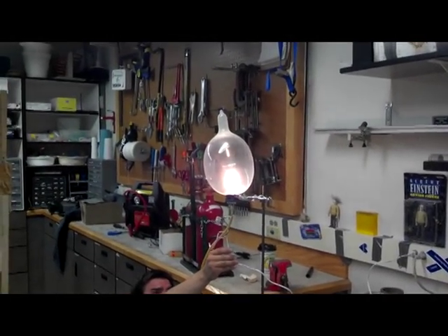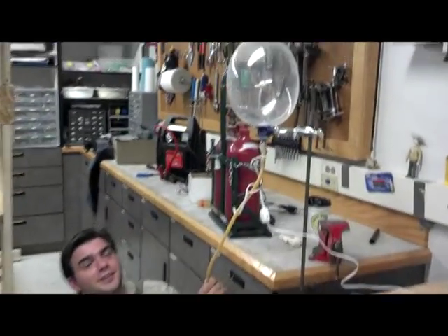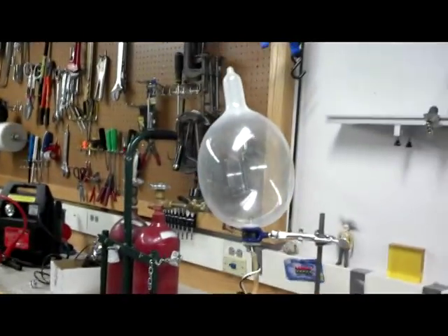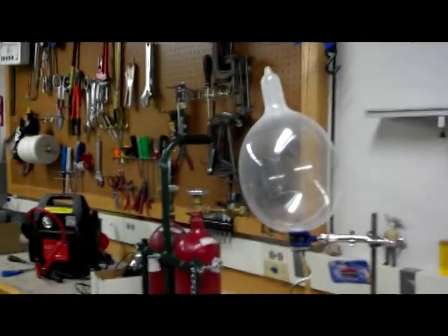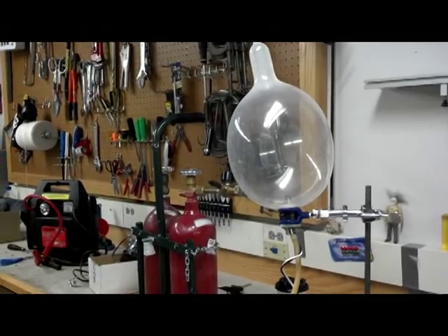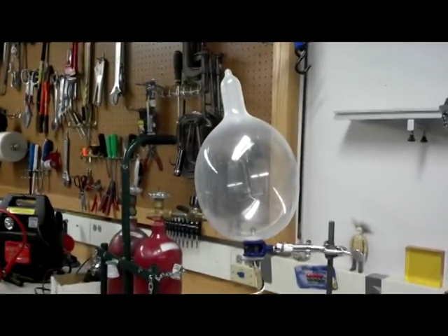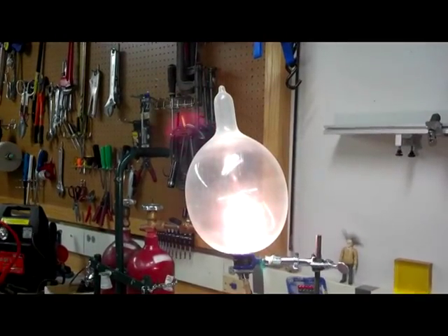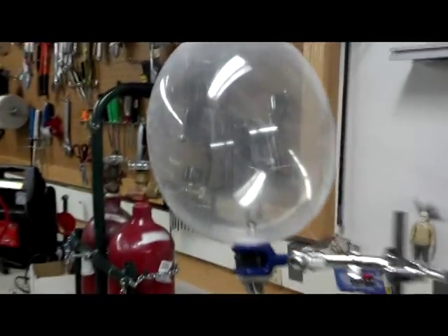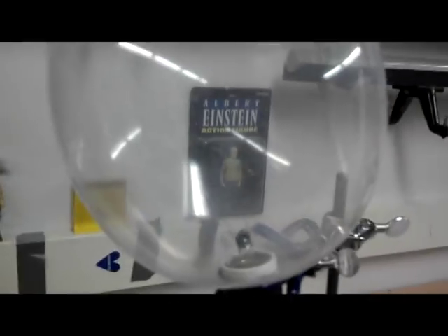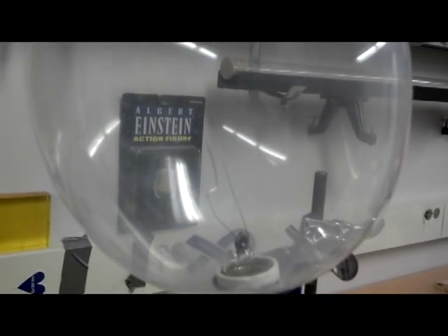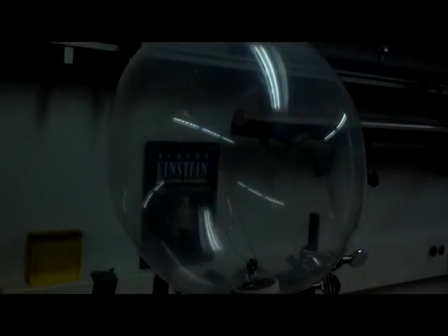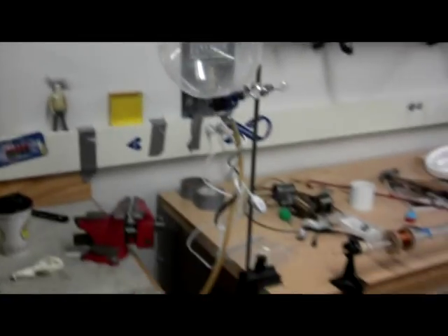Can I turn it off now? Yeah. You think I can turn it back on one more time? Or do you think there's air diffusing in there? I don't think there's air diffusing in there yet. Stay clear. Okay. There's a glare right over the filament. Here we go. Yeah, I think we're good. Okay. Alright.